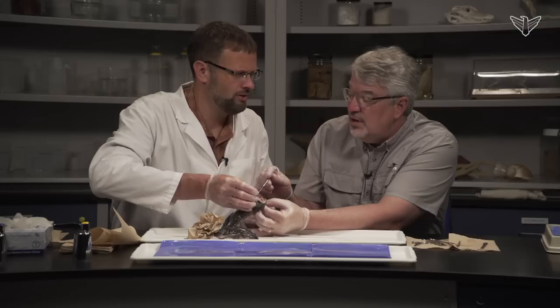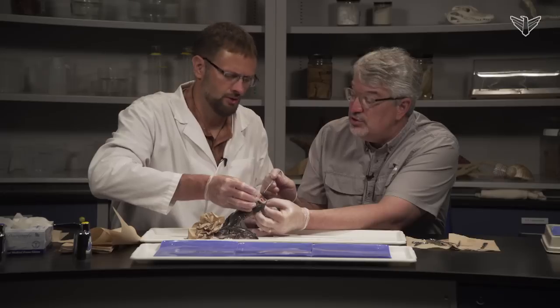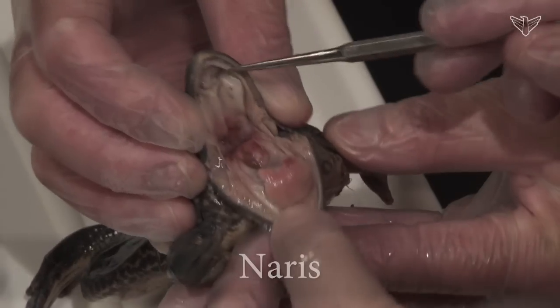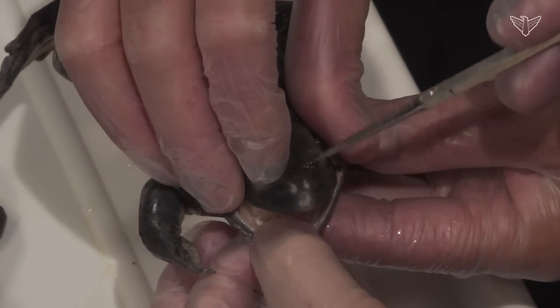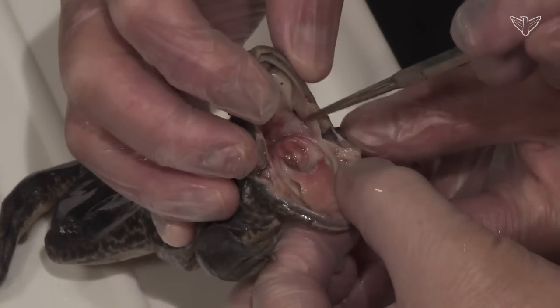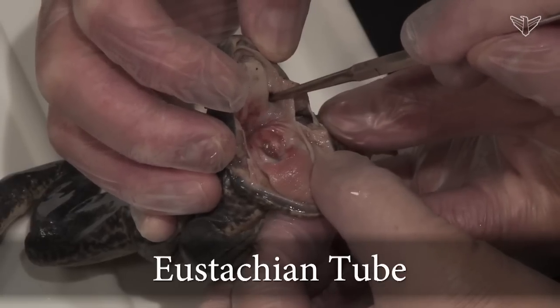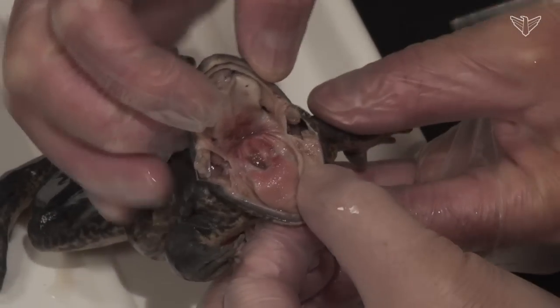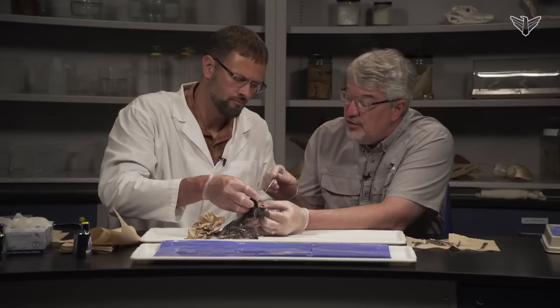They're mostly carnivores — mostly eating insects and other small aquatic animals. And then there are the internal nares here, which open from the nose, so they have paired nostrils that open into the mouth area. And then a little harder to see back here are the eustachian tubes, which are the internal openings to the ear — there's one on each side. Those equalize the pressure between the inside of the tympanic membrane and the inner ear.